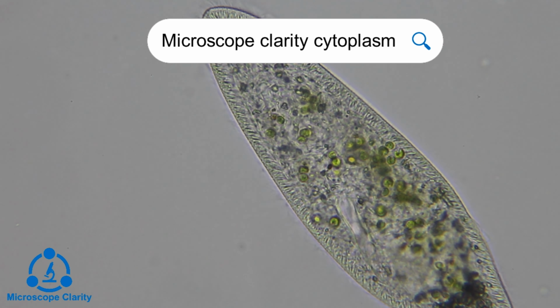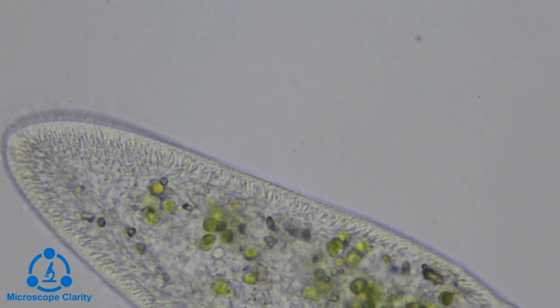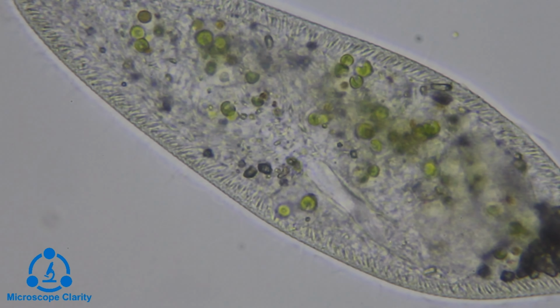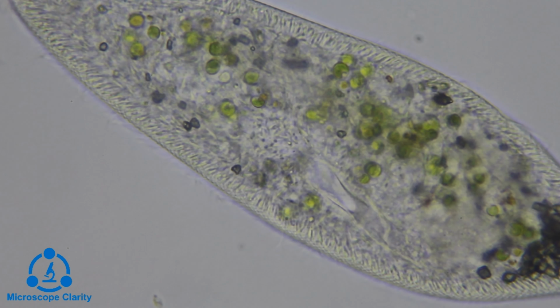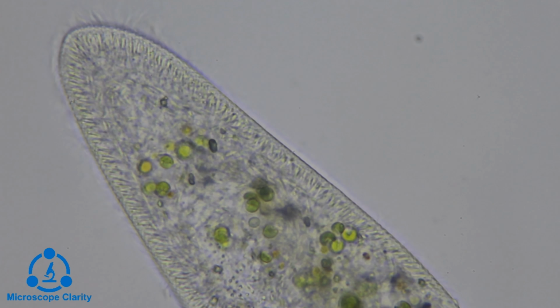In this paramecium, you can see cytoplasmic granules and symbiotic algae, those little green particles, flowing in a rotational pattern. Cytoplasmic microtubules play an important role in the cytoplasmic streaming process.